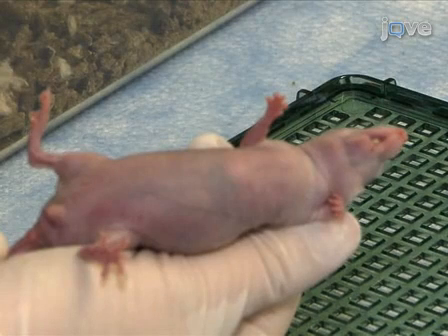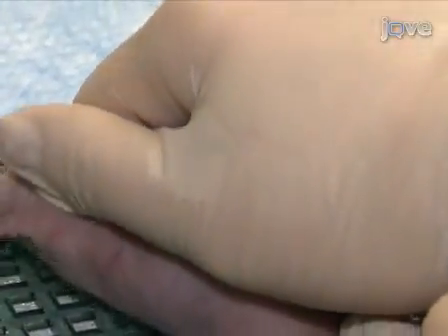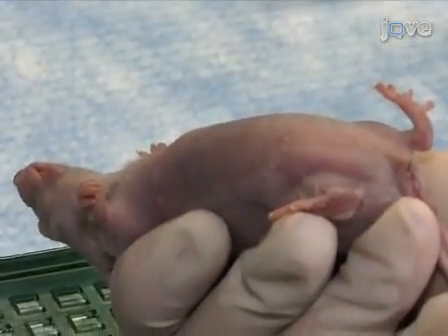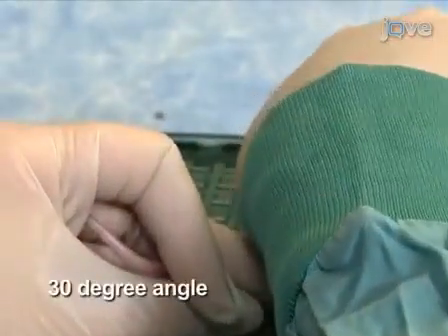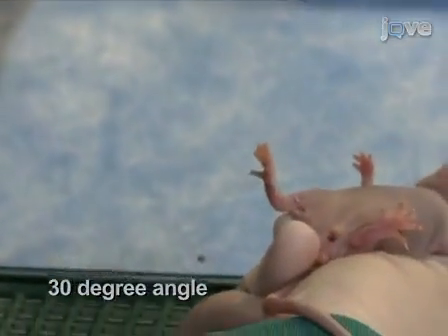Turn the mouse over so that the abdomen of the mouse is facing upwards. If the mouse can freely move its head, release the grip and try again so as to avoid being bitten during the injection. Hold the mouse slightly inverted to help move the organs away from the injection site. Insert the prepared syringe needle at a 30-degree angle into the lower left quadrant of the mouse.